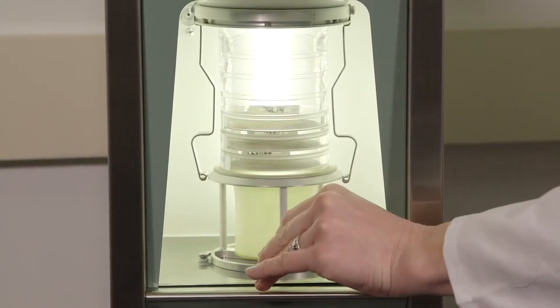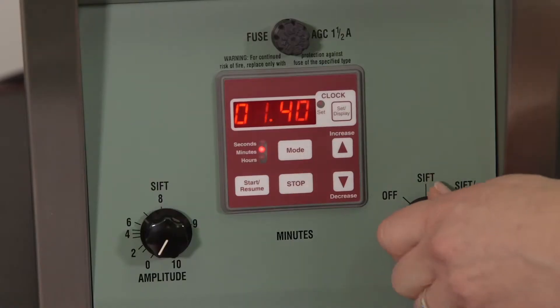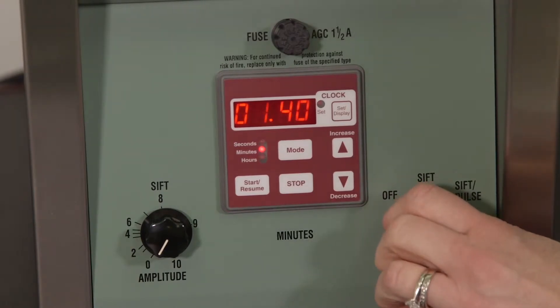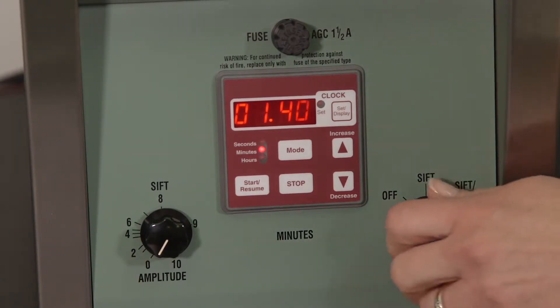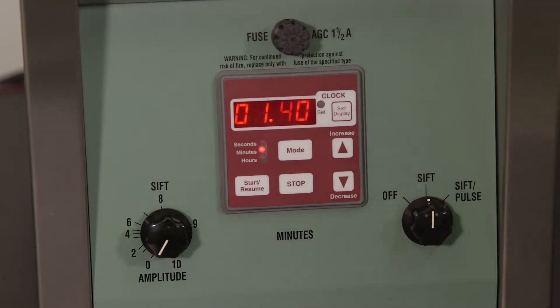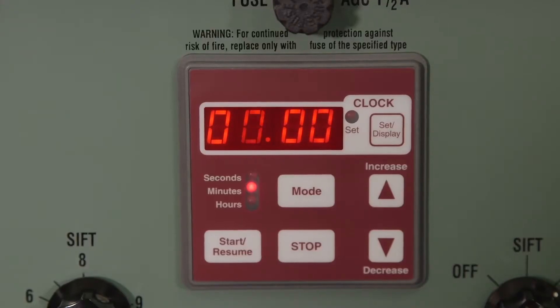With the column lock arms clipped down, slide the test stack into the test chamber. Be sure to orient the stack in such a way that will allow for clear viewing of the sample. Release the column lock arms to form a tight seal. Lower the chamber door.